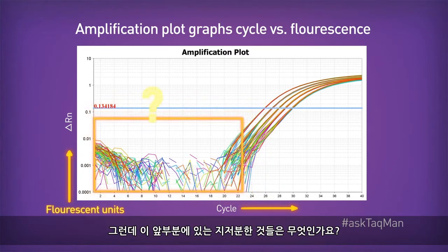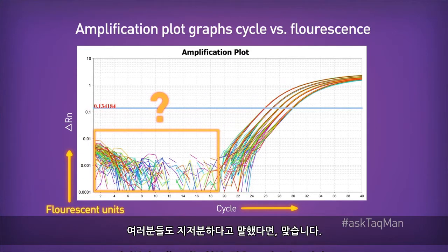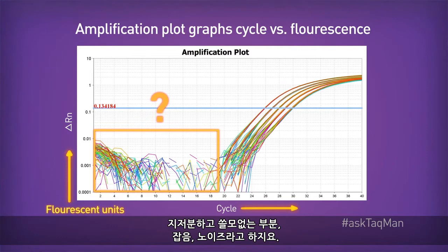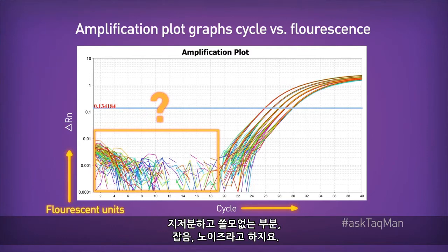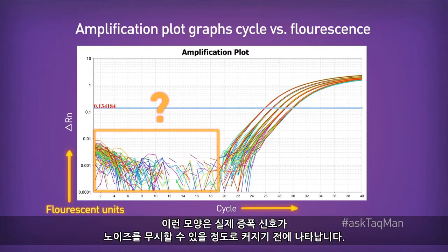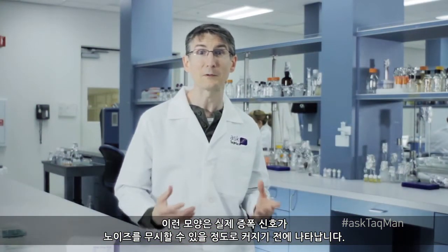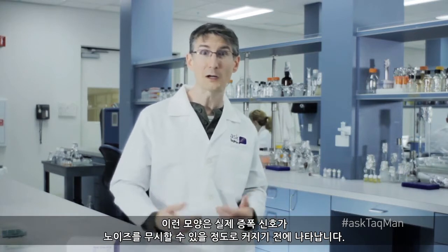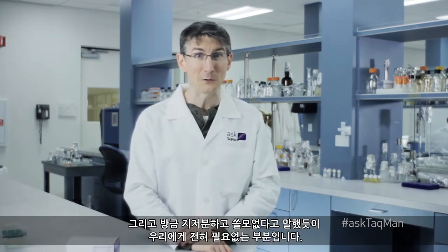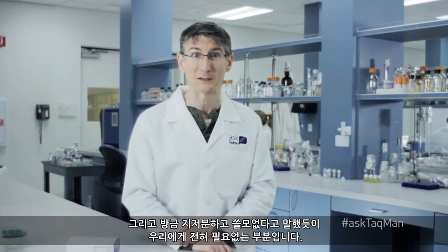But what's all this junk in the early cycles? Well, friends, if you said junk, you were right. Junk, trash, waste, detritus, garbage — otherwise known as noise. It's the stuff we see before our actual signal from amplification gets high enough to overcome that noise. And as those rather impolite adjectives suggest, it's completely useless to us.